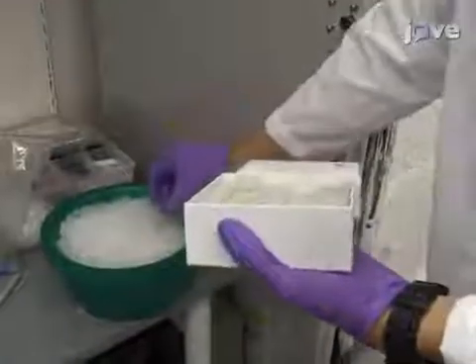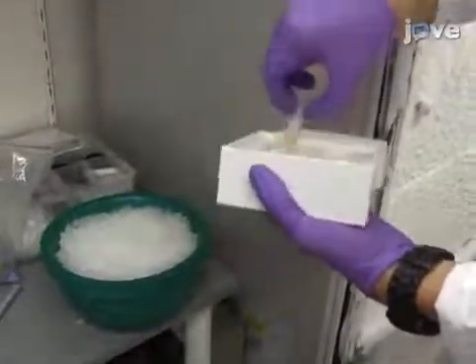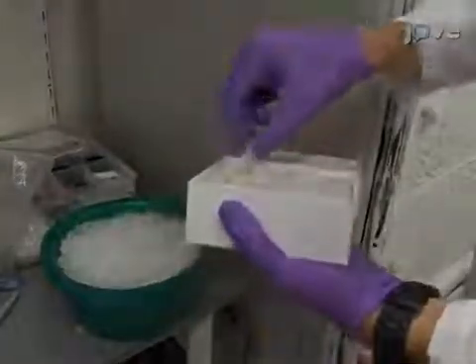The following day, remove the frozen DAMV5POI and V5 DAM lentiviral supernatants from the freezer.